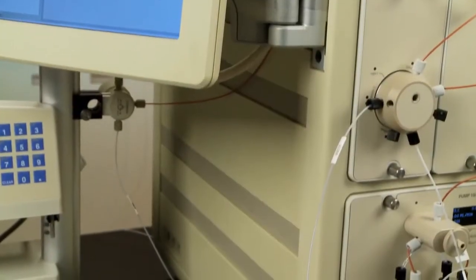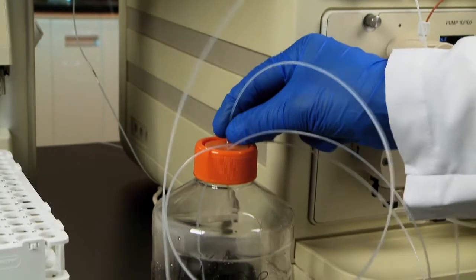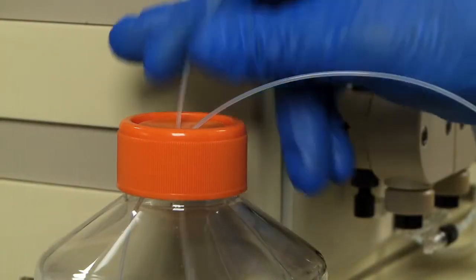The waste container should be placed next to or below the NGC. Do not place the waste container on top of the NGC.